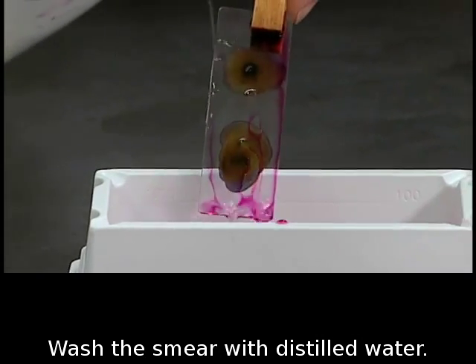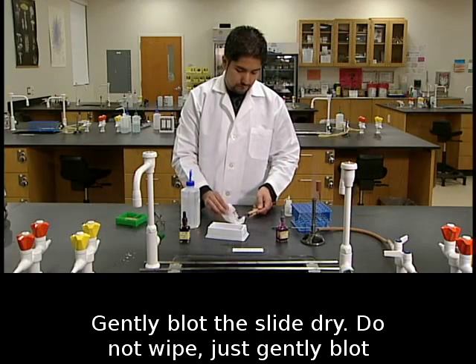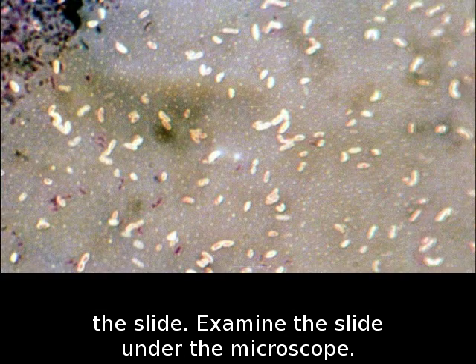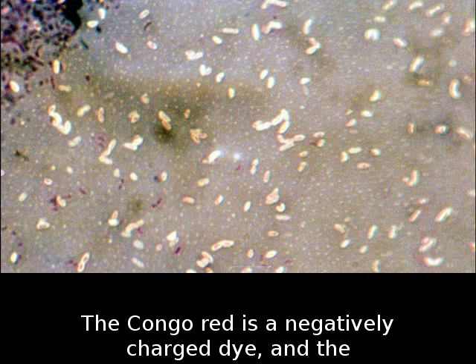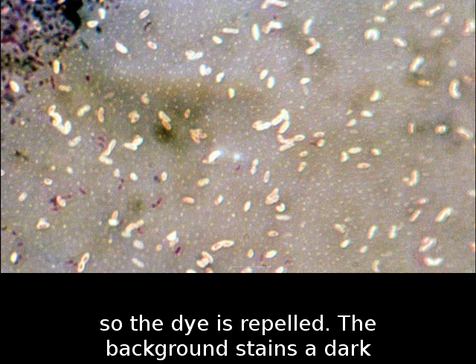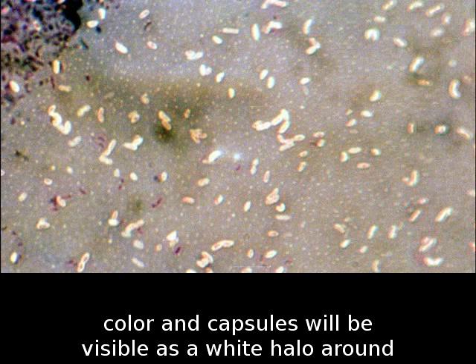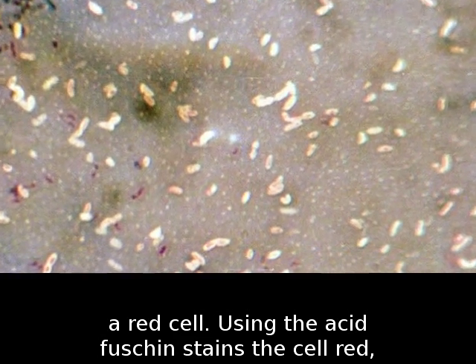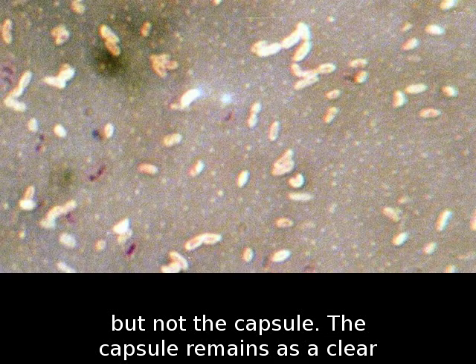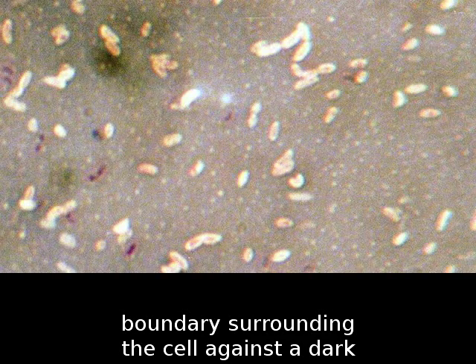Wash the smear with distilled water. Gently blot the slide dry — do not wipe, just gently blot. Examine the slide under the microscope. The Congo Red is a negatively charged dye, and the bacterial surface is also negatively charged, so the dye is repelled. The background stains a dark color, and capsules will be visible as a white halo around a red cell. Using the acid fuchsin stains the cell red, but not the capsule. The capsule remains as a clear boundary surrounding the cell against a dark background.